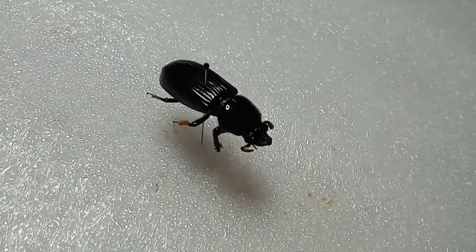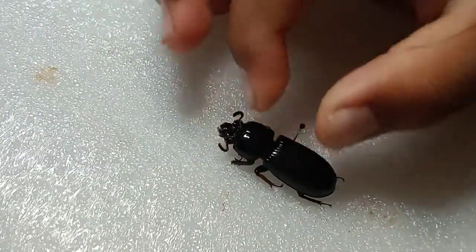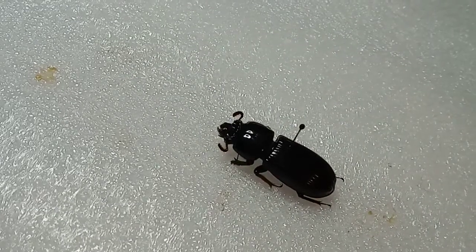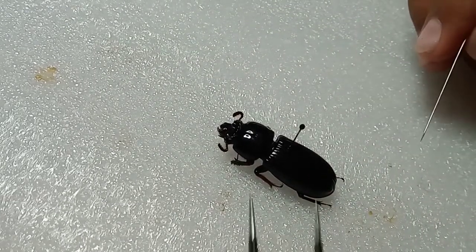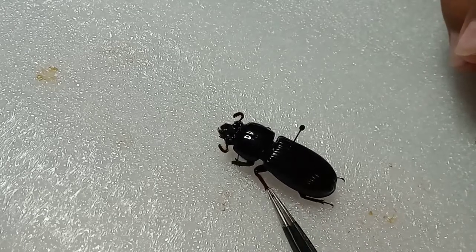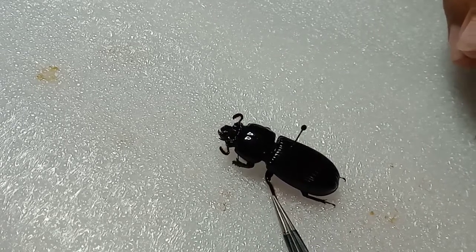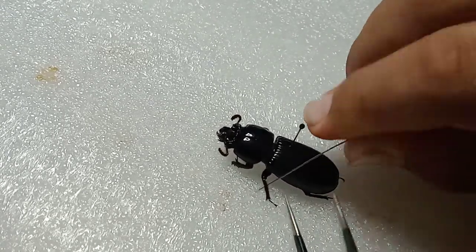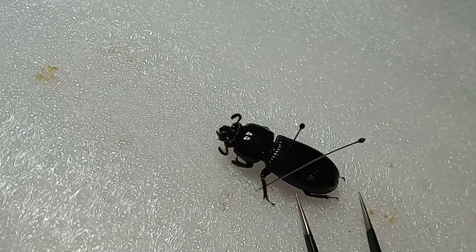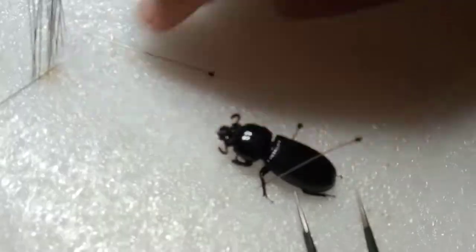Let's get a little bit more light in there. Hope y'all can see it. Next you want to put it a little bit down. Then you're going to want to start spreading. With your entomology forceps or fingers — these are much better to grab them. You're going to want to spread out its legs so it looks nice and neat. Let me get a few more insect pins.